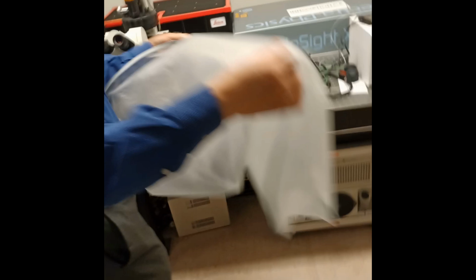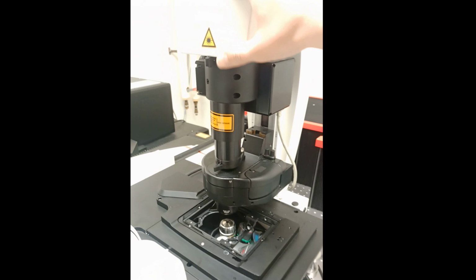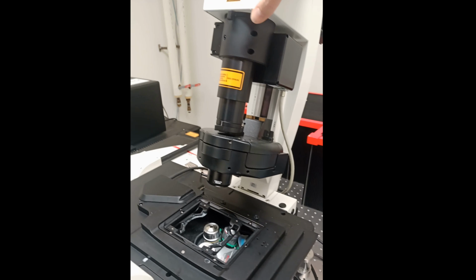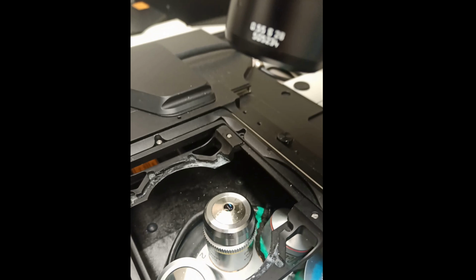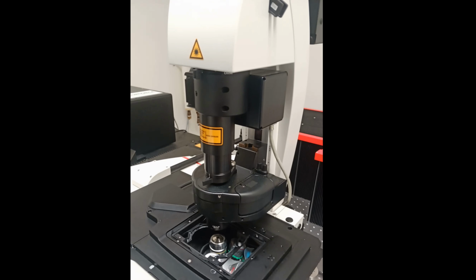Remove the cover from the microscope body and place it in the provided bin. Do not put it on the laser or any other equipment. The previous user should have left the 10x objective in the active position, but check this before every startup. If it is in the 25x or higher, you will have to change it to the 10x once all hardware has started and before initializing the stage through the software, or the objective will crash into the stage.